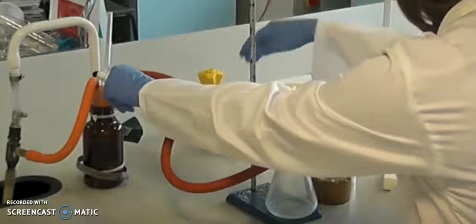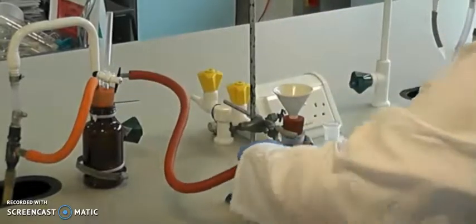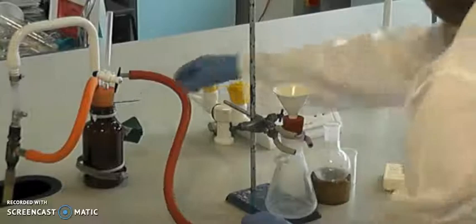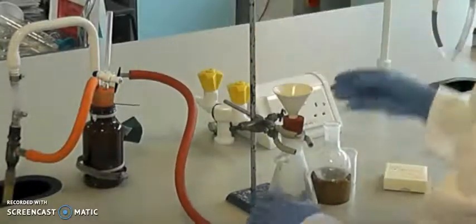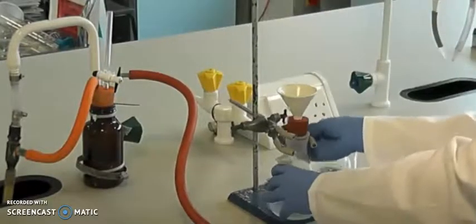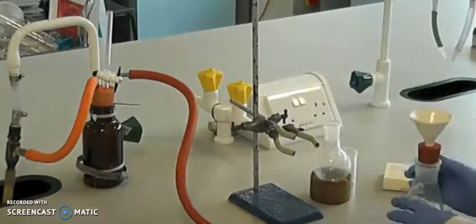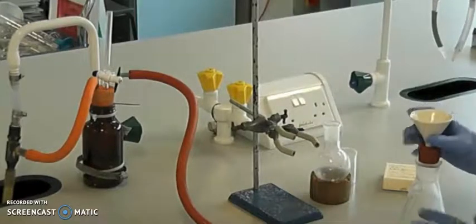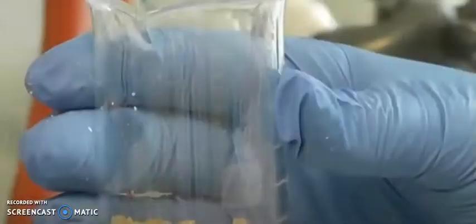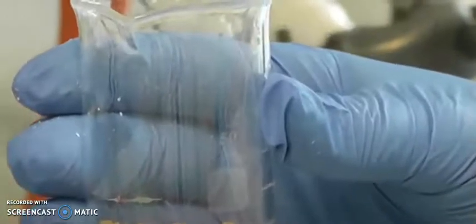And then you will get the dried sample. Then you release the pressure, disconnect all setups, take it out. This is your compound.